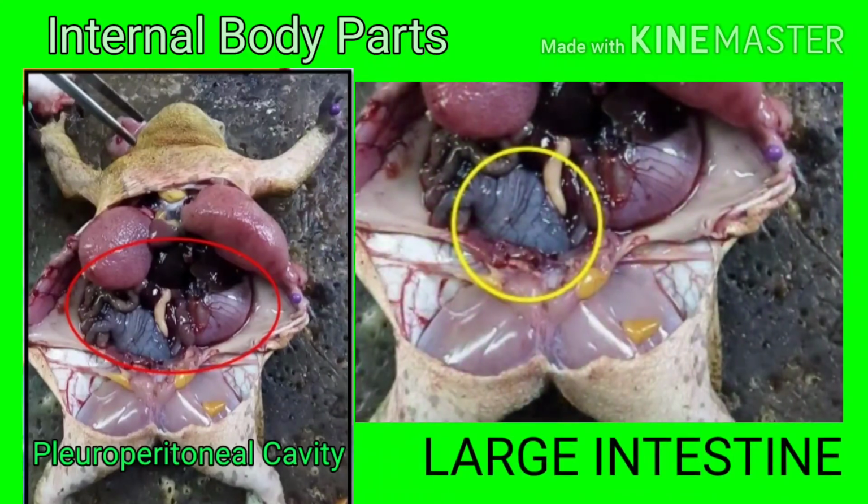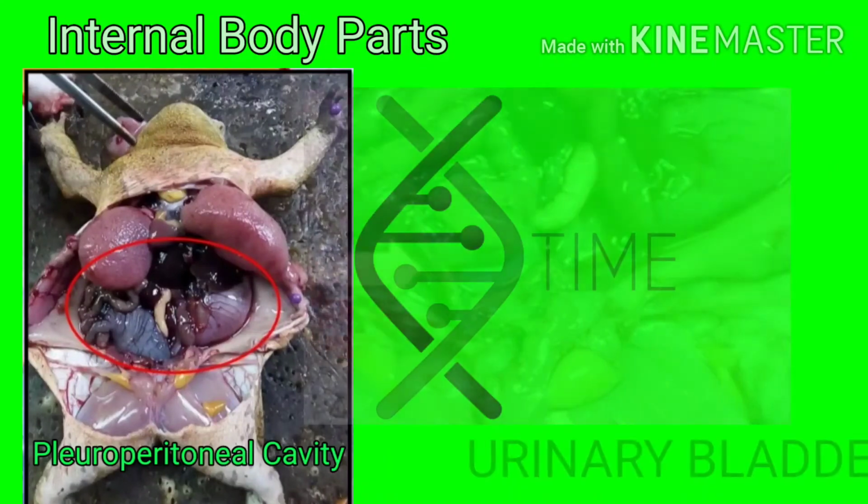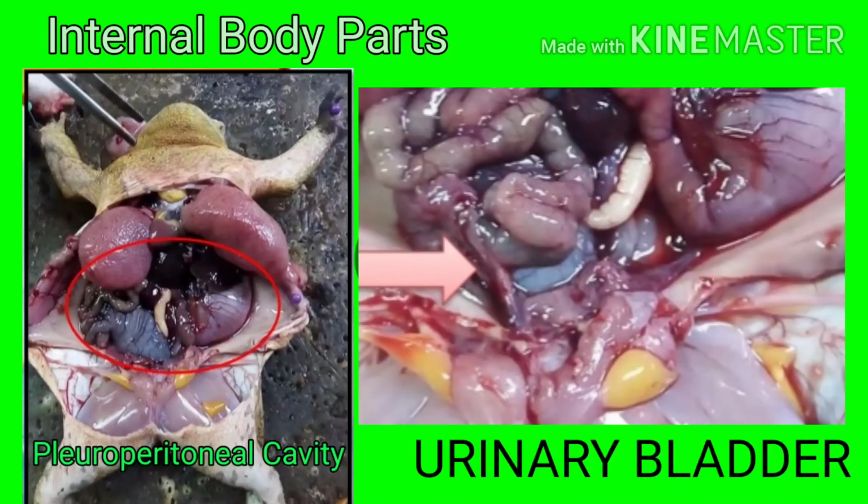Next is the large intestine, which continues from the small intestine and ends at the anus. It is a straight, uncoiled, club-shaped and dark tube which stores and solidifies waste products by absorbing water. Next, we can see the urinary bladder, a membrane-like bilobed sac that is ventral to the posterior end of the large intestine. It collects and stores urine until it is released.